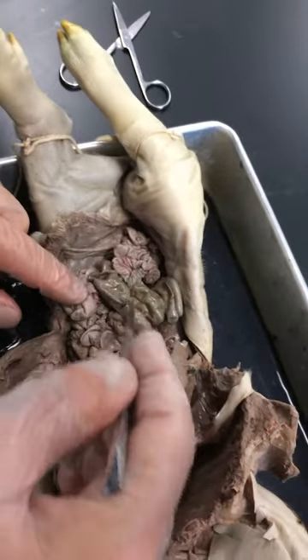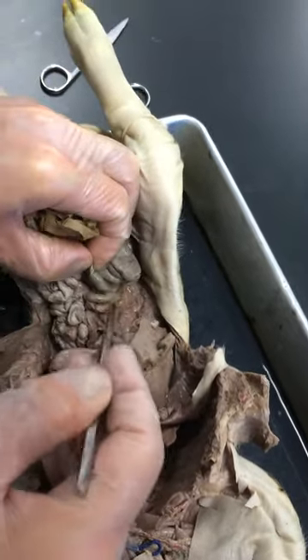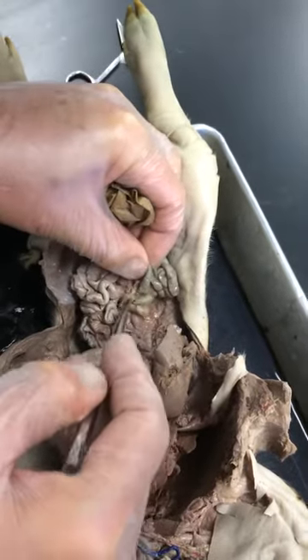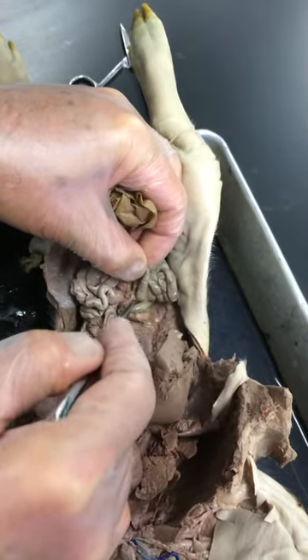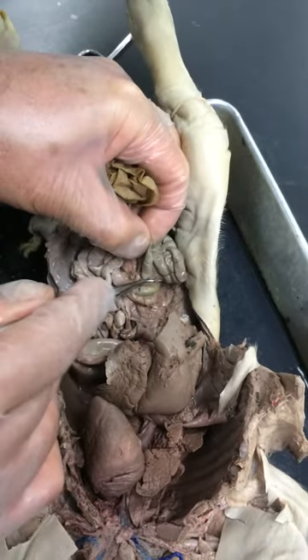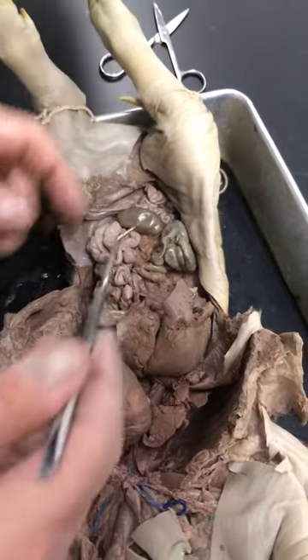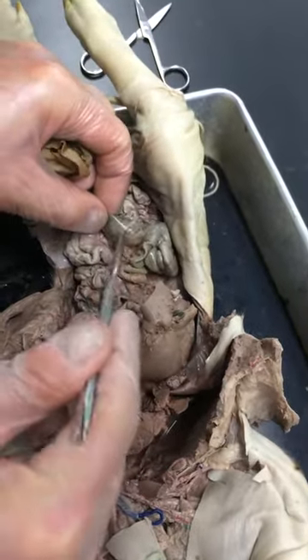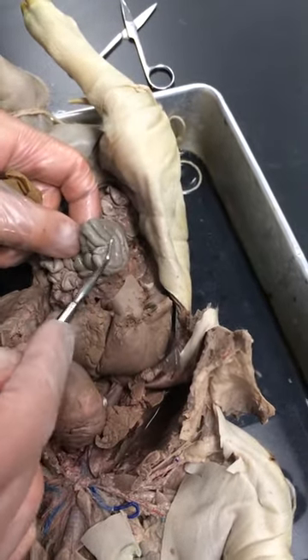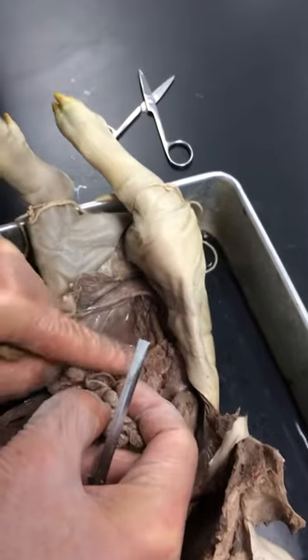The cecum looks like a second stomach almost. The ileum of the small intestine comes right in there, and there's a little sphincter — that'd be the ileocecal valve. The ileum comes in and goes right into the cecum. The cecum is the proximal beginning of the large intestine. You can see it's kind of a spiral configuration — that's the spiral colon. And then the other part is a single tube which goes down to the rectum, called the descending colon.